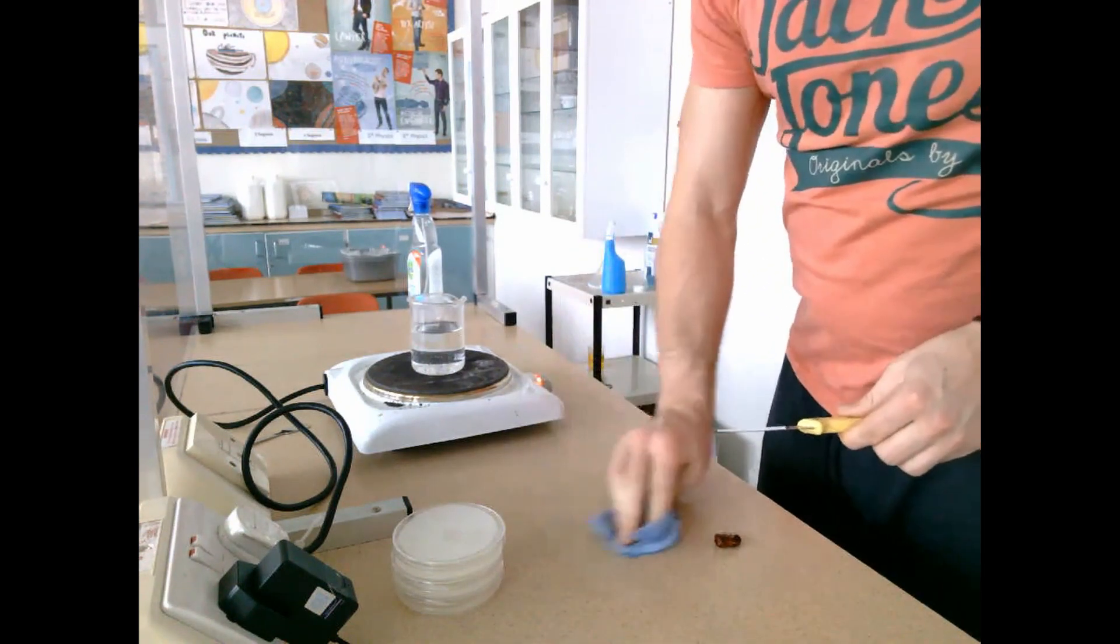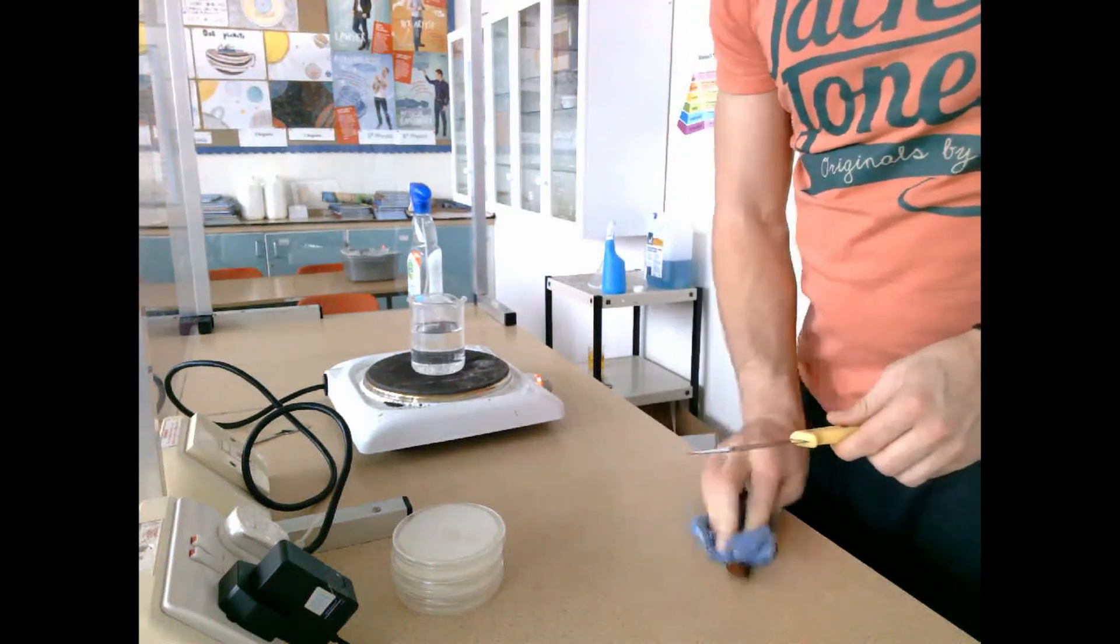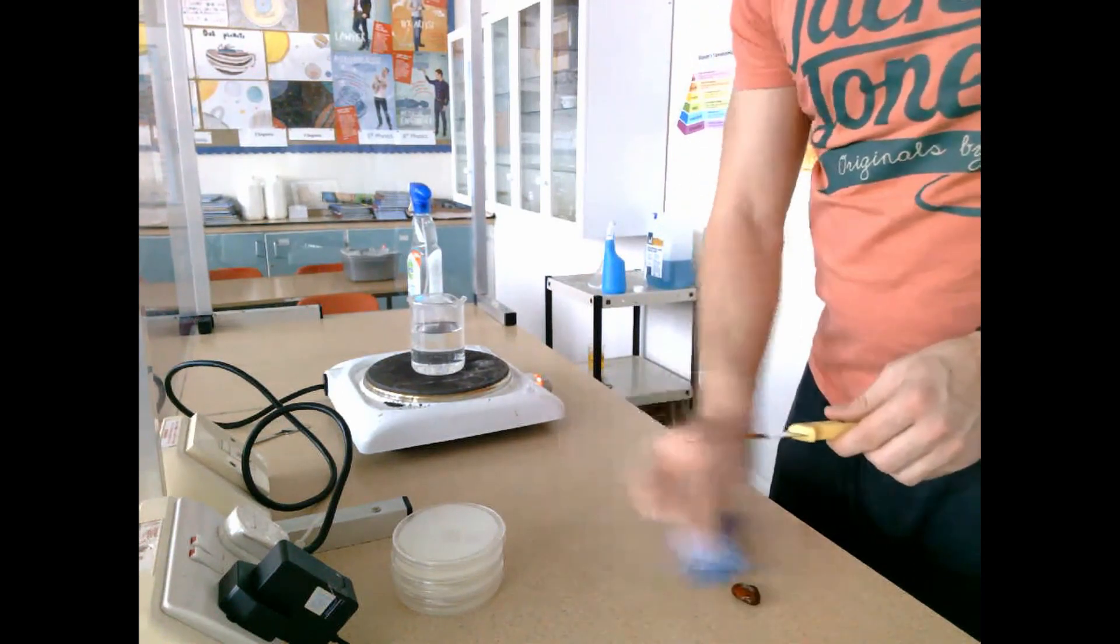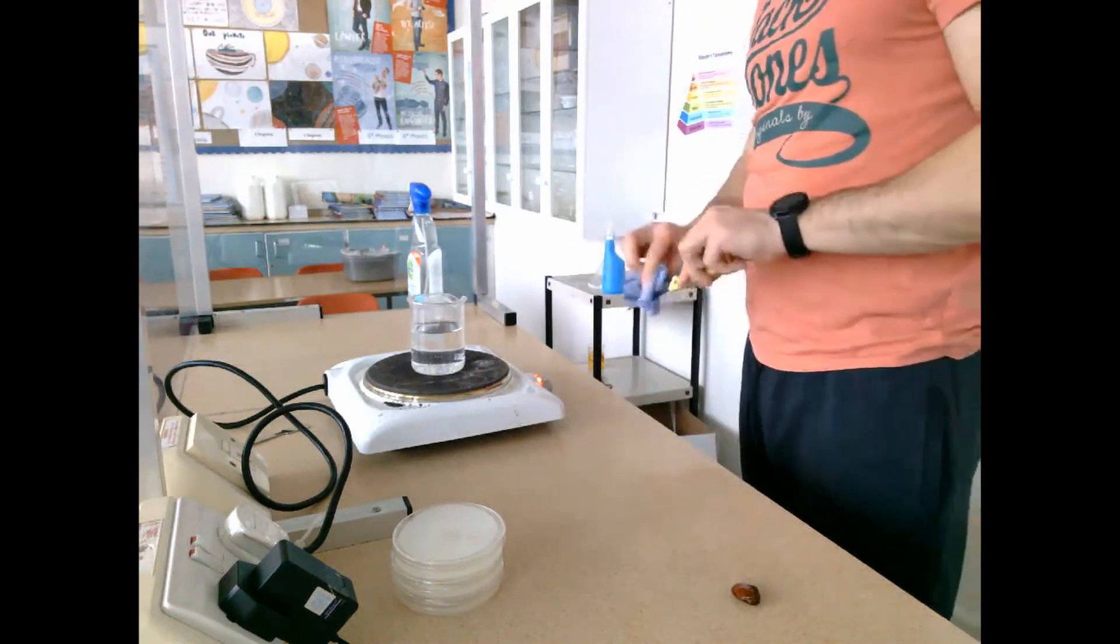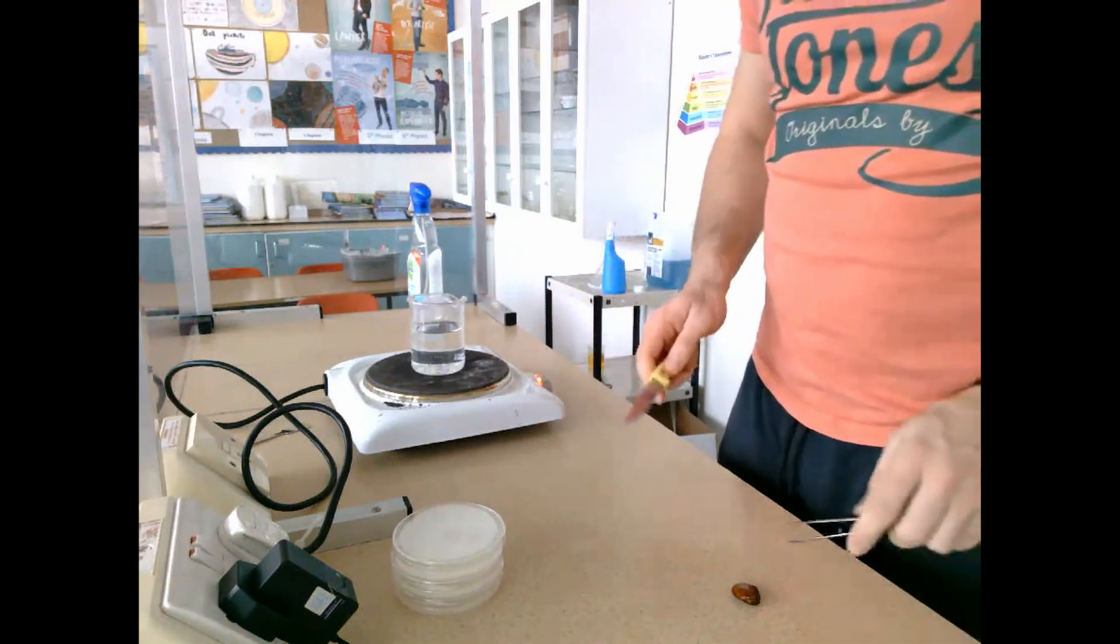I take my first seed and try to cut it with the scalpel. Didn't work. Had to go get a knife, come back, and do the same thing. I grab the seed and cut it in half.